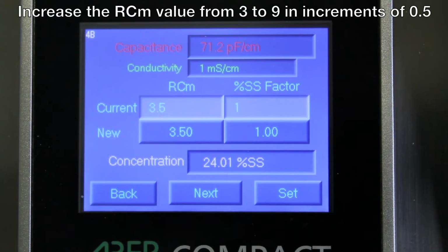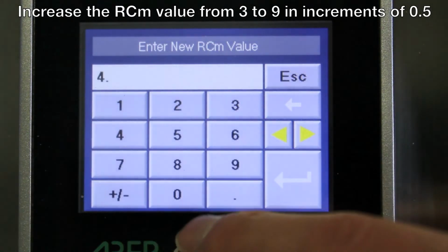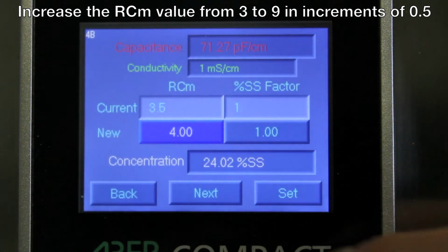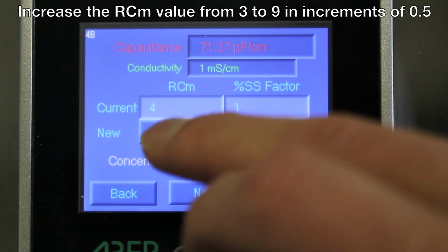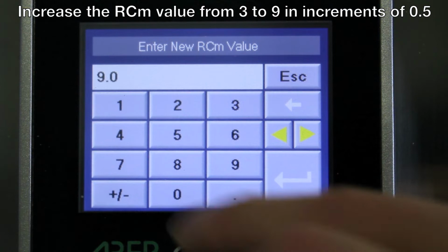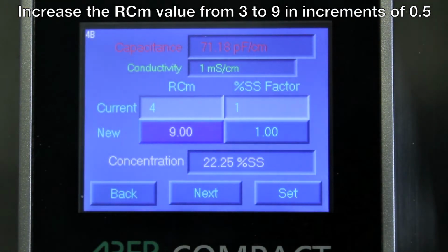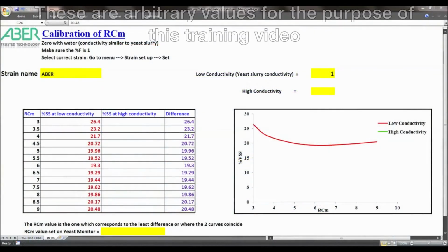Record the new percent spun solids concentration value and then change the RCM value again to 4. Set it and see the concentration value changes. Record it and keep going, incrementing the RCM by half each time till the RCM value reaches 9. Eventually the screen will look like this, with 9 on it, and in this case concentrations drop down to 21.16% spun solids. You should have all the values recorded in your spreadsheet.